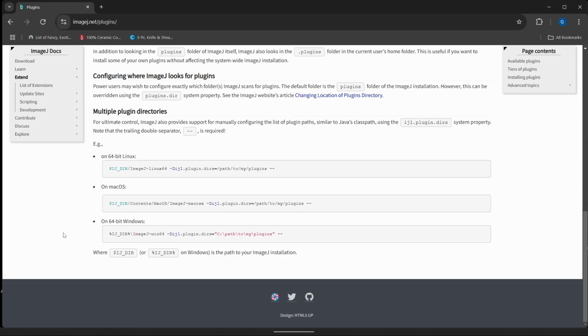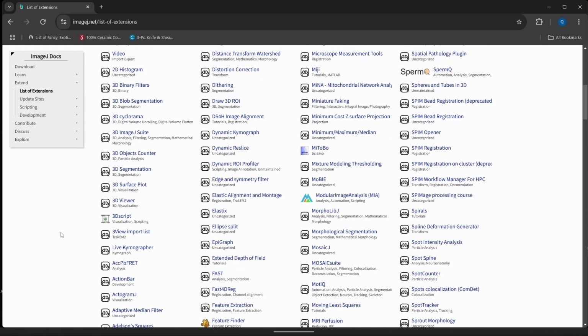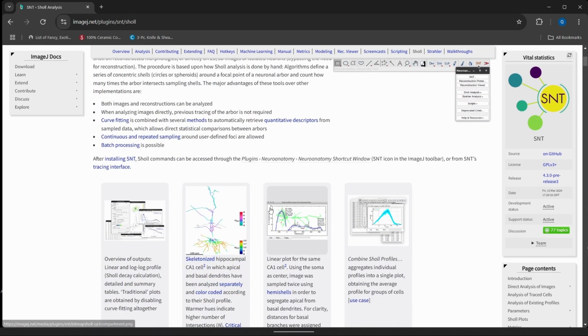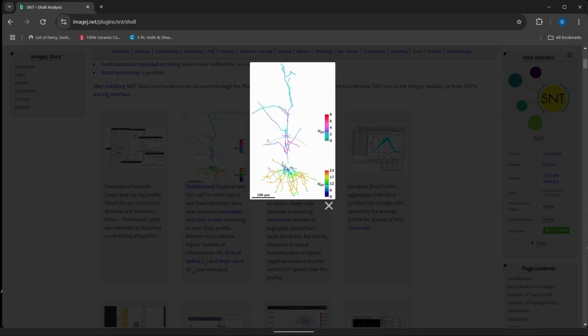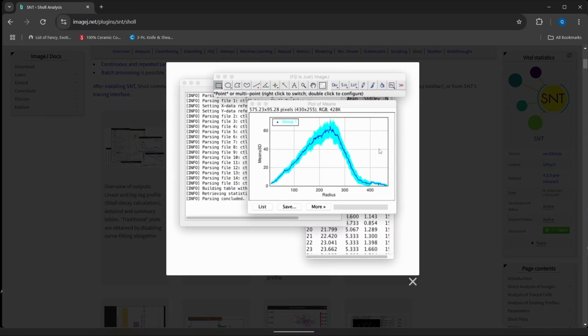So these plugins are extra bits of software that can help ImageJ do things that it normally wouldn't be able to do. I actually, for my project, use Simple Neurite Tracer, which is a plugin that allows me to do what's called Sholl analysis, which is a tracing of the different branching patterns of neurons. And then we can actually take a look at them and figure out where exactly they are being branched as far as distance from the center goes, or the nucleus. And we can kind of see exactly what morphological changes might be a little bit more difficult to describe otherwise, especially quantitatively. And I only learned how to do that through the wiki, maybe a couple of YouTube videos, but this is a really, really great resource that you would be really smart to properly utilize.